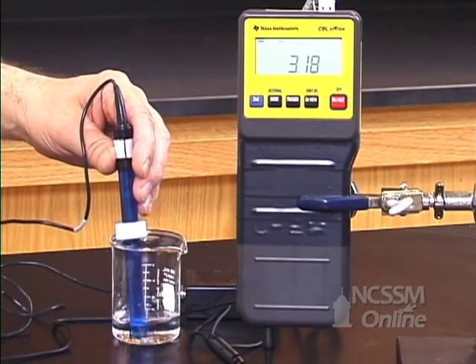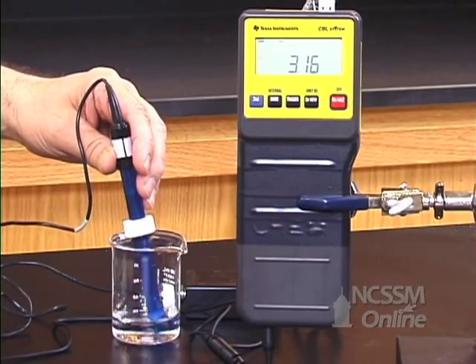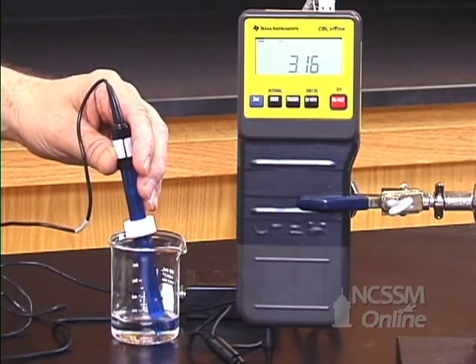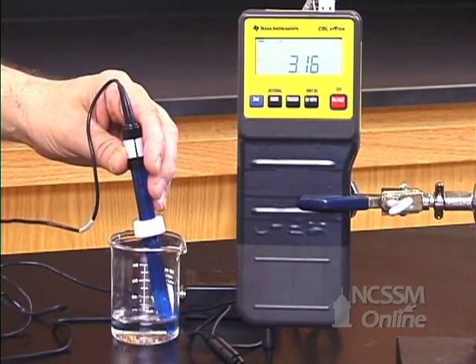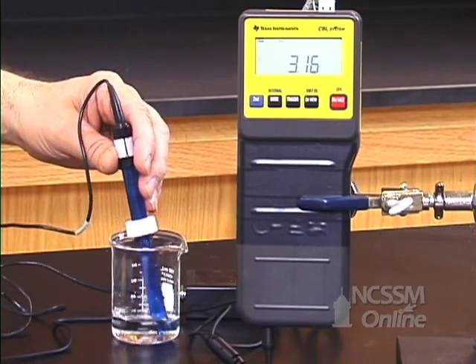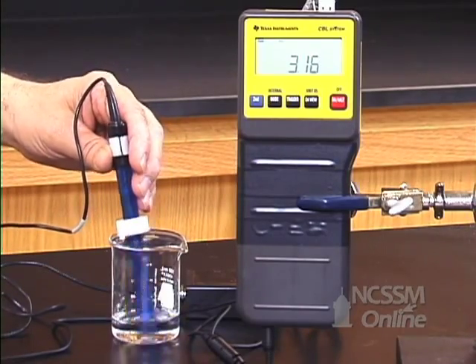It will not neutralize nearly as much added acid or base. It only takes 5 drops of the 1 molar HCl solution to destroy the buffer.